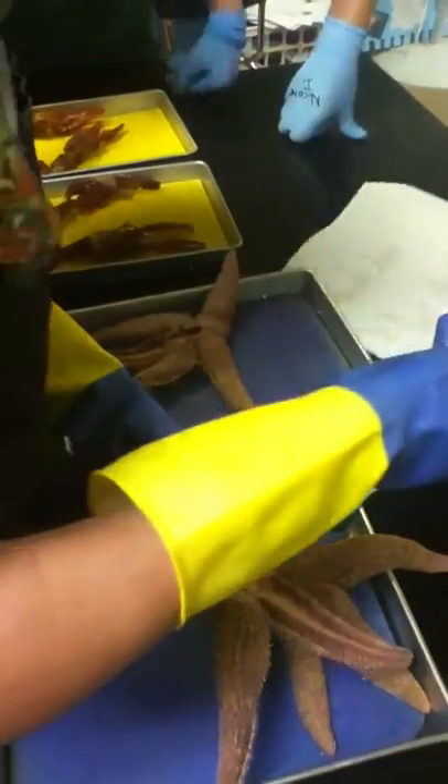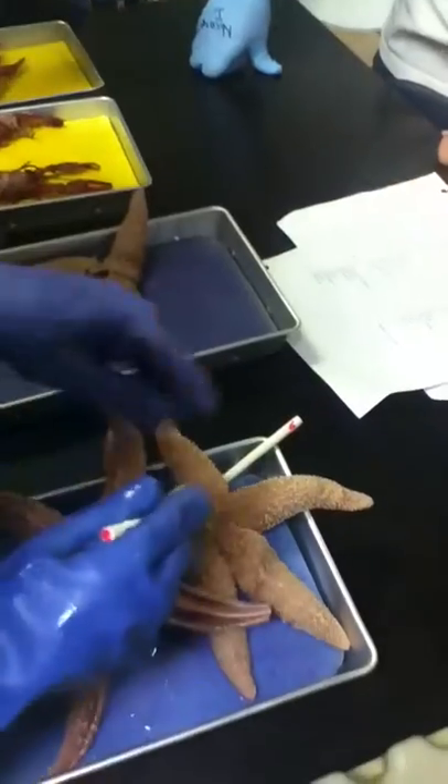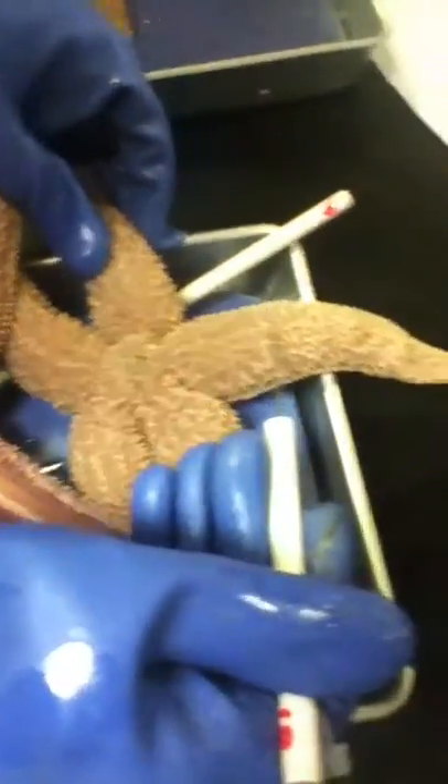It's too hard for us to do male-female, so we didn't do that. They do have separate male and female. What's this called? The white things are spines, which is part of the endoskeleton.